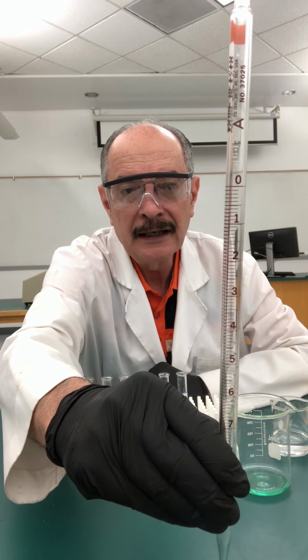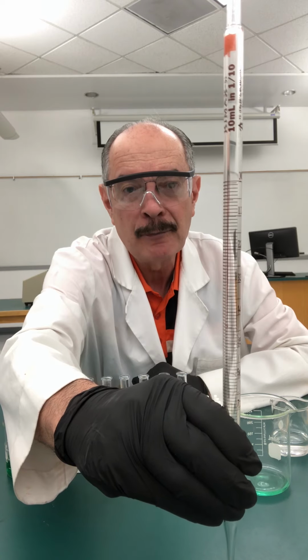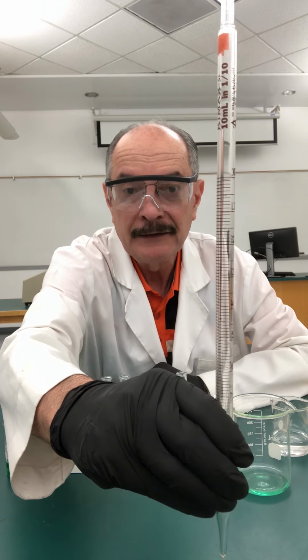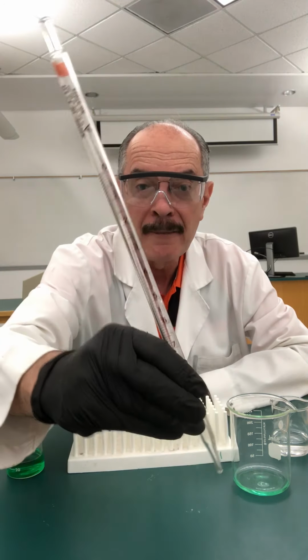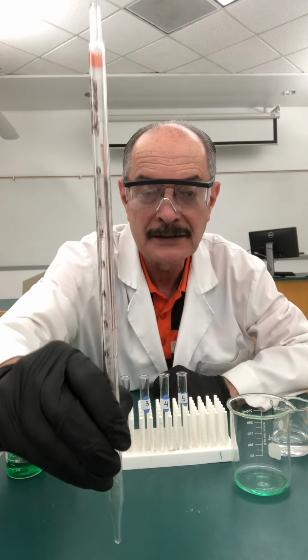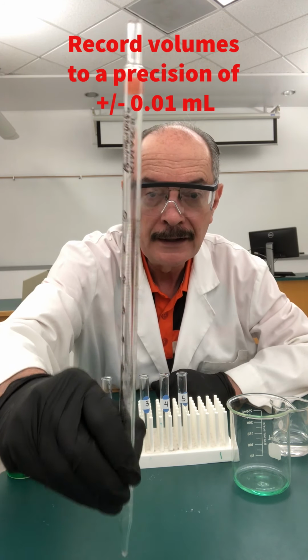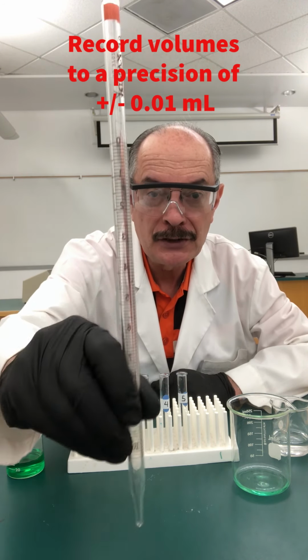It's marked in units of milliliters, but it's also subdivided into intervals of 0.1 milliliter. That means that when you record a measurement with this instrument, you record to one more decimal, right? So to 0.00 milliliters.